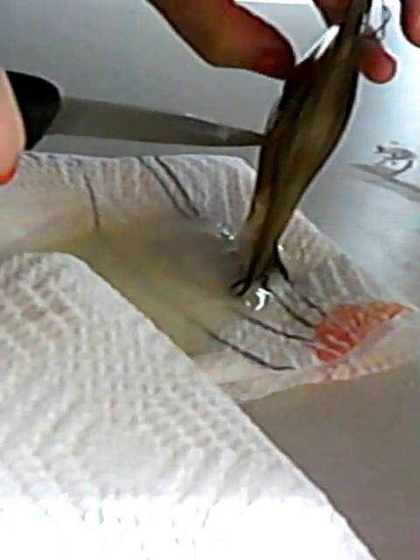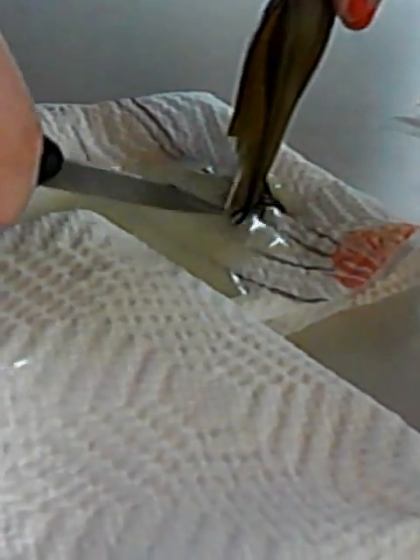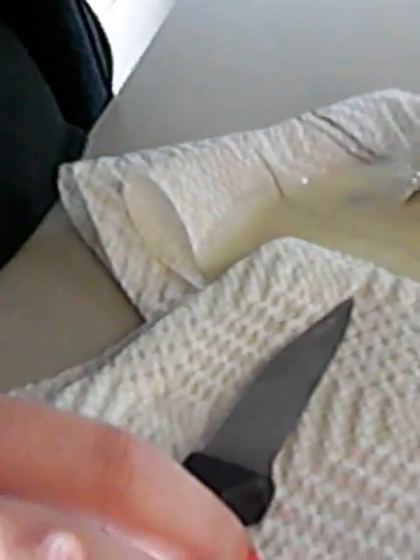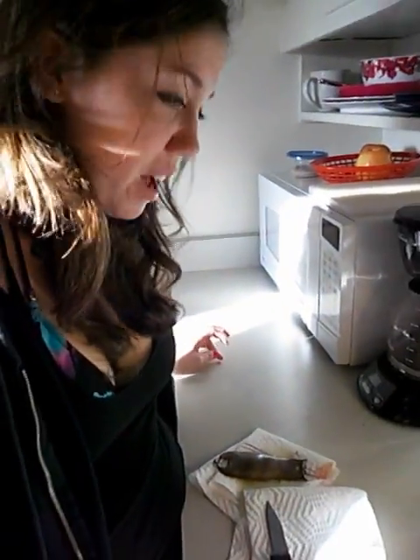That, I think, is what this boils down to. Show the viewers. Here, viewers — look inside a shark. There's nothing in there, it's just goo. All that is inside of it is goo — it's like a bunch of boogers. That was disgusting but very educational. So now you know what shark placenta looks like. It smells pretty nasty, like rotting fish or something like that. But happy to state that there wasn't a shark in there, so I don't feel like a terrible person. That's all I have today for biologist hour. Signing off now.